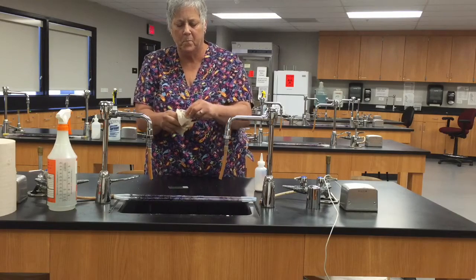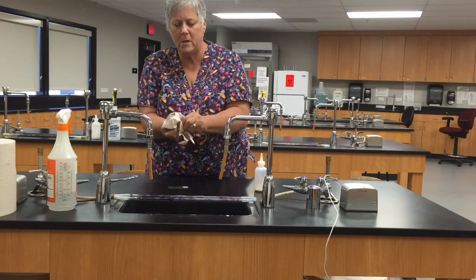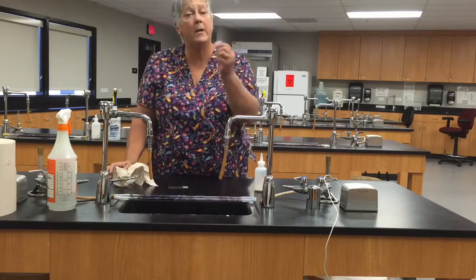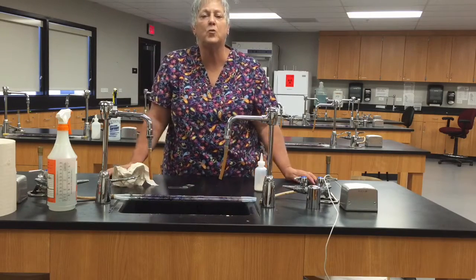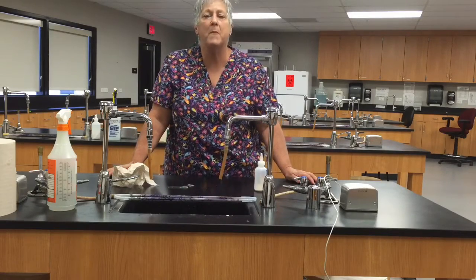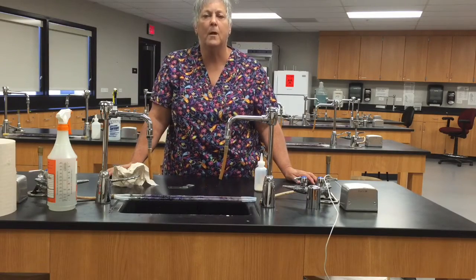And then I just need a bit of paper toweling and I'm going to dry that thing off, do a good job here and it's all ready to go. So I will pick this up with a demonstration on how to actually make the air dried heat fixed smear. Be back in a minute.